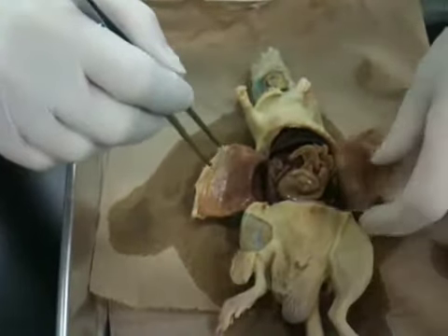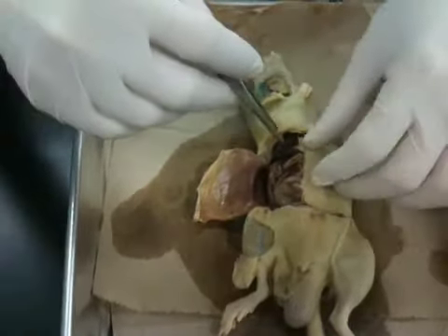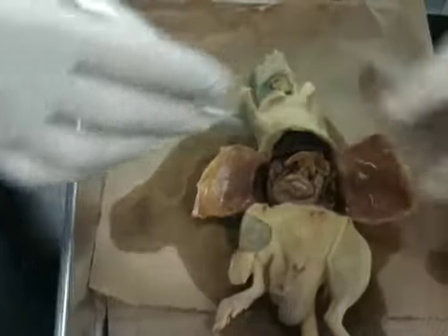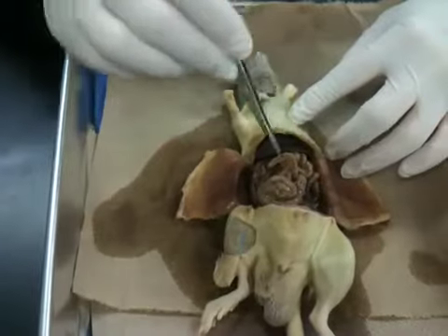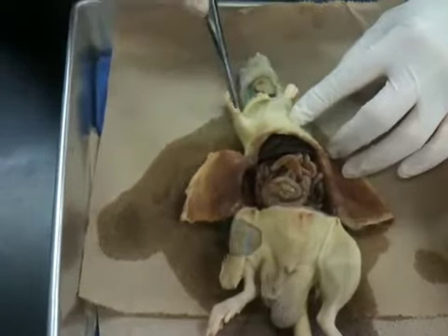So as you can see, the incision was done for the skin and for the muscle. So lay out your rat like this. You will notice that you have the liver, you have intestines, and you have some other items. So let's go through those.